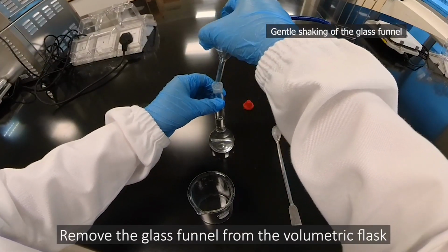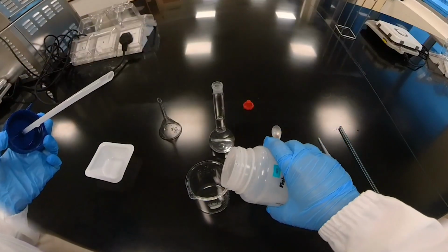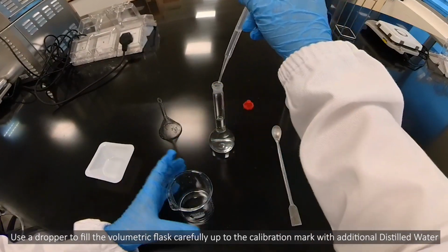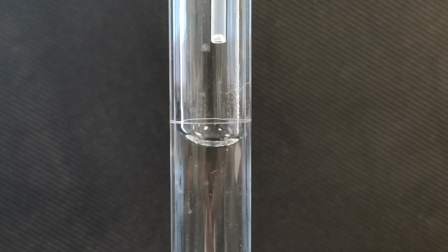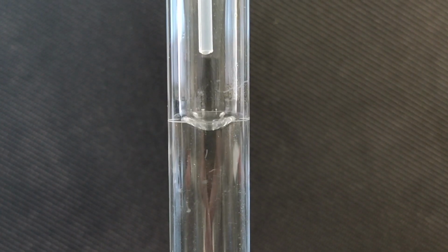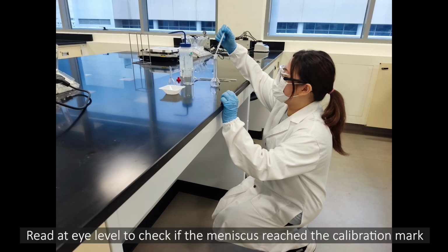Remove the glass funnel from the volumetric flask. Use a dropper to fill the volumetric flask carefully up to the calibration mark with additional distilled water. Read at eye level to check if the meniscus reached the calibration mark.